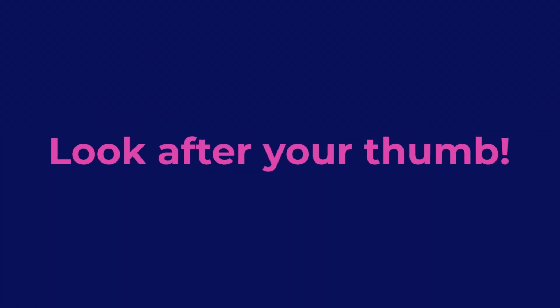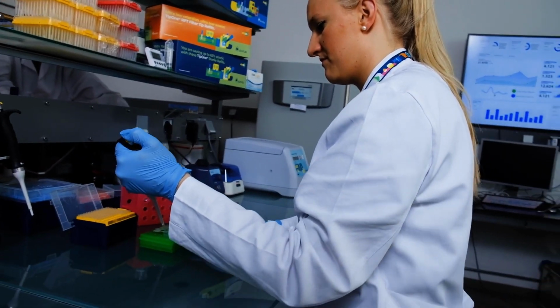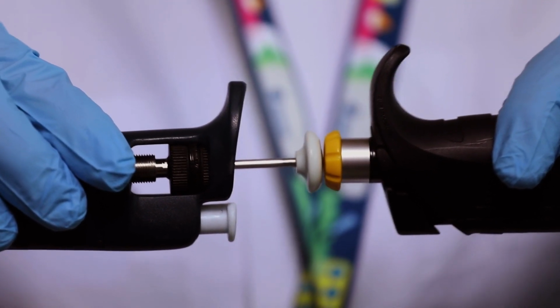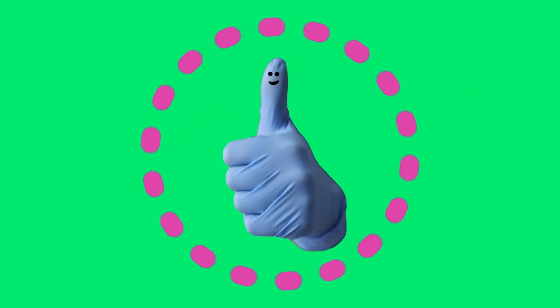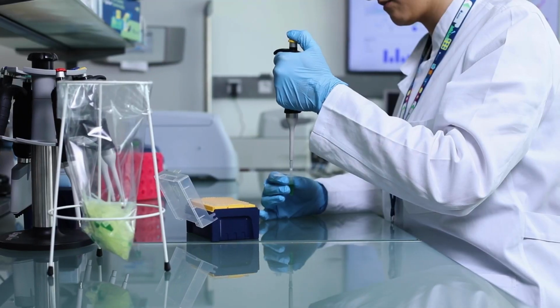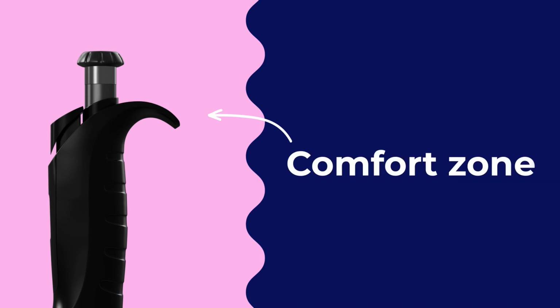You also need to look after your thumb. You use it twice for every pipetting cycle. To do so, choose a pipette with minimal pipetting forces. The lighter the spring in your pipette, the less force or resistance is needed to use the pipette. This will keep your thumb happy. So remember, get comfortable. Okay, maybe not that comfortable. There we go. Get your workspace set up to suit you. Make sure your bench is comfortable to stand or sit at, and your workspace is organized. Don't let pipetting be a pain, and get into the comfort zone.